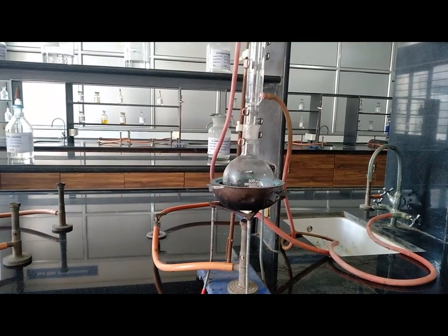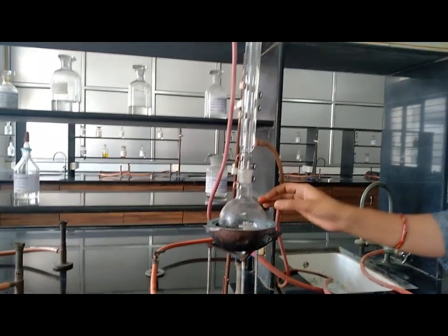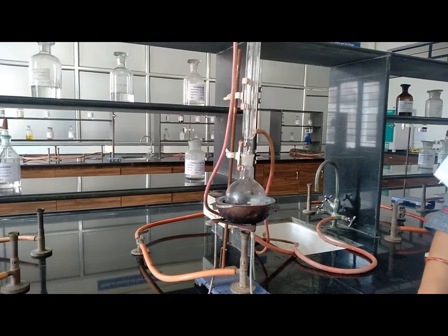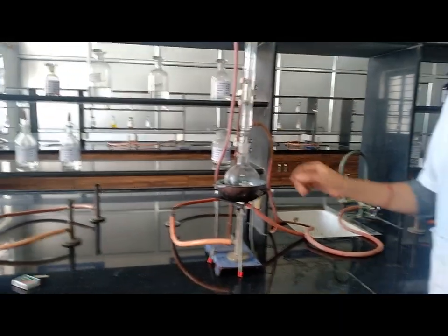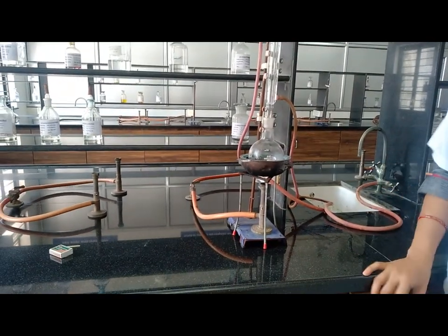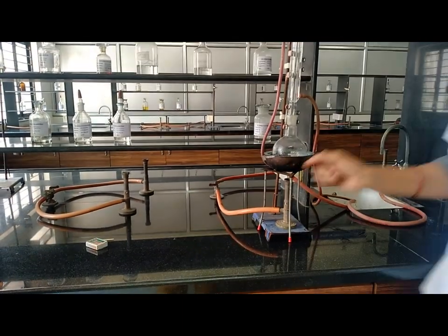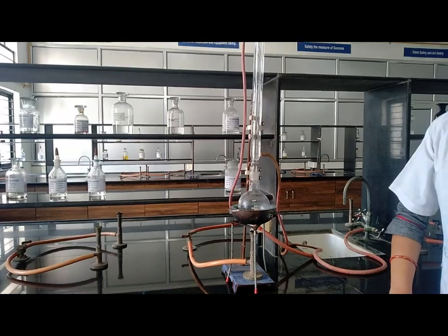Gently heat for 30 minutes so that the reaction occurs in the RBF and we get the product. Now 30 minutes are over, therefore first stop the heating, then remove the flask from the condenser and perform further procedure.